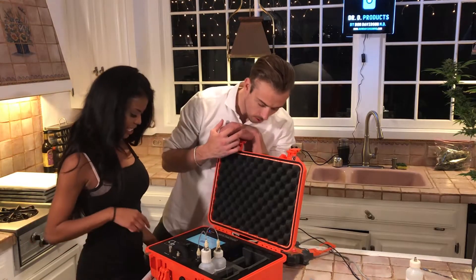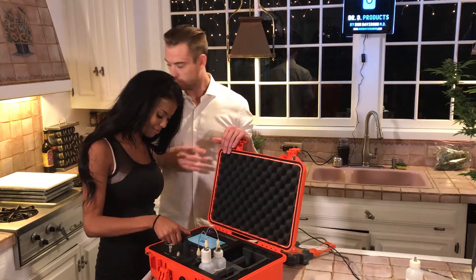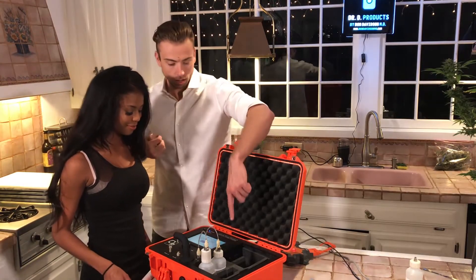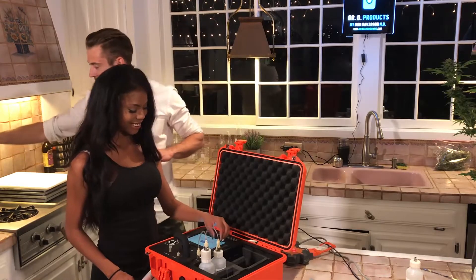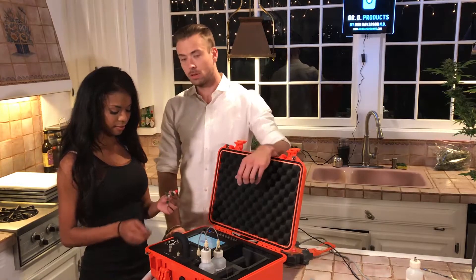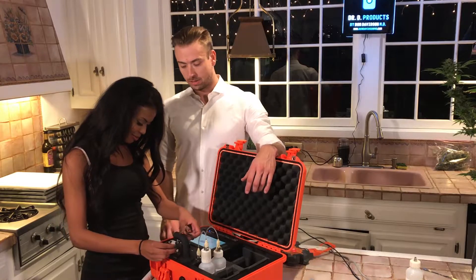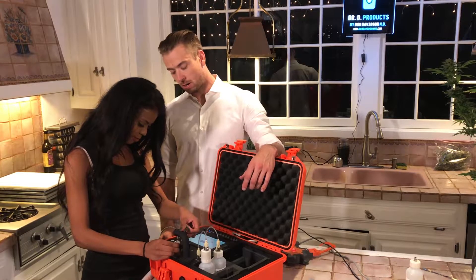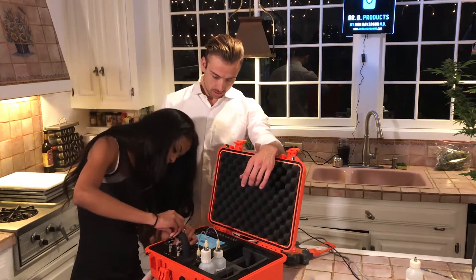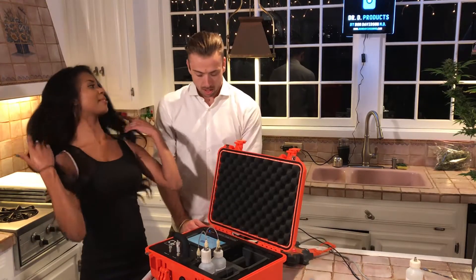You're going to gently pull up on this, and in here — oh yeah, look at this, very handy — it even has a little lid on it. So go ahead and pull that up. There's your column. Just take the end caps off and gently seat that in there. You can push it a little bit tighter — just got to line it up if you're a little bit off center. There you go. Good job.